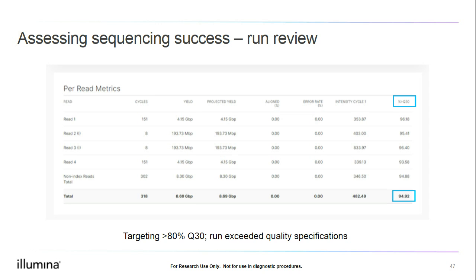Second, we will evaluate the data quality. We will look at the percent Q30 column and then look at the bottom of the table for the run total. In this run, the percent of the data generated that is at or above Q30 is 94.92%. We wanted at least 80%, so we also exceeded our quality expectations for the run. Reviewing the run performance is our first step in assessing the success of our Amplicon sequencing. For this run, we are exceeding both our output and quality specifications, so we know that the sequencing run performed well and we can proceed with data analysis.